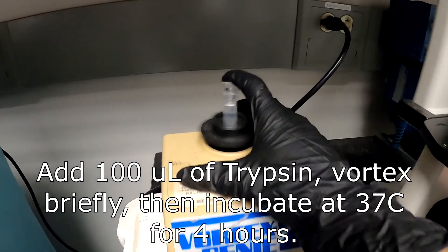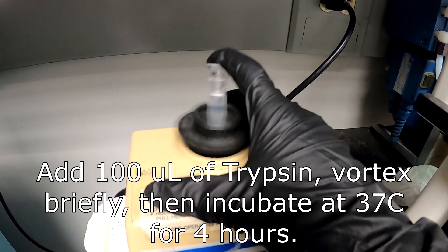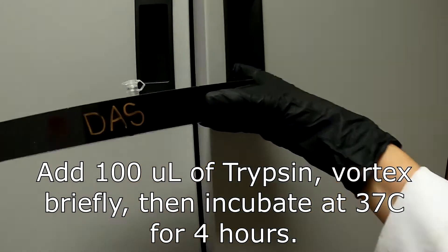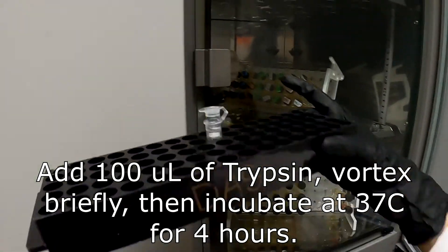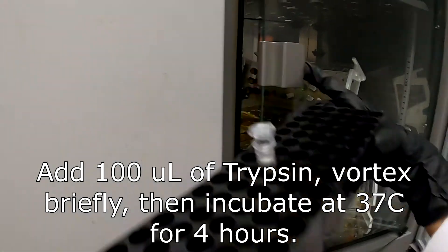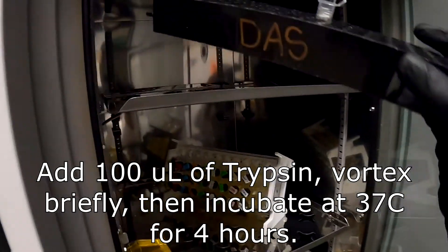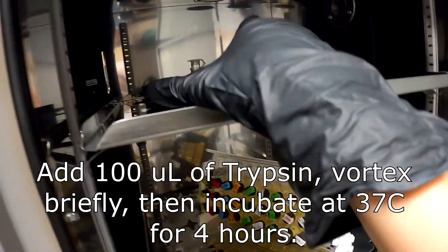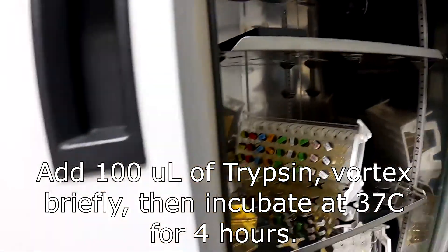The activity of trypsin is optimal at pH 8. Ammonium bicarbonate forms a mildly alkaline buffer when it is dissolved in water, and it is commonly used to buffer trypsin digestions. Ammonium bicarbonate can also be removed by lyophilization easily.